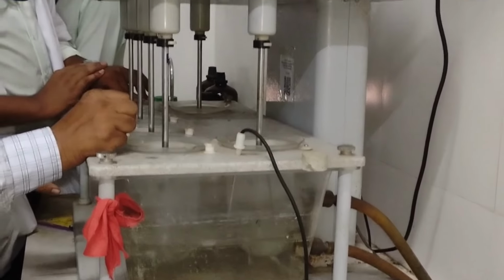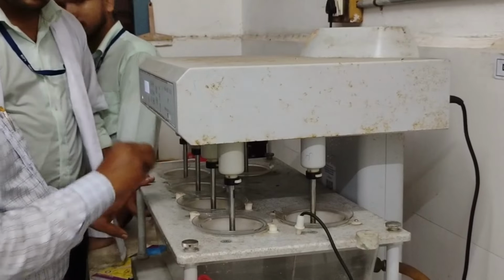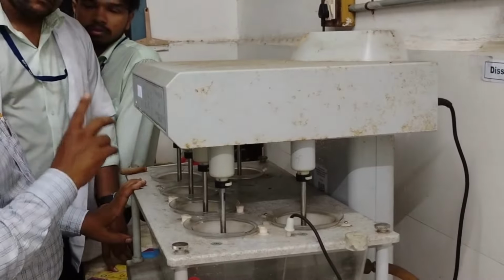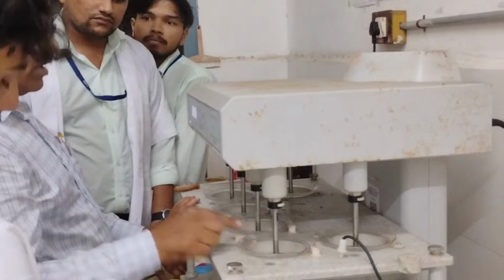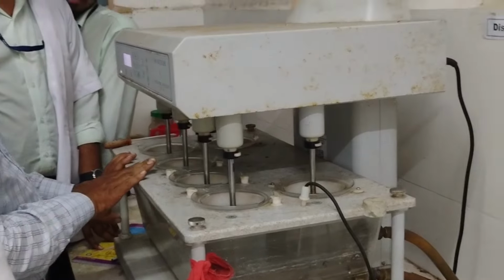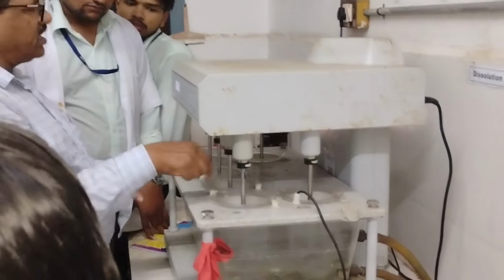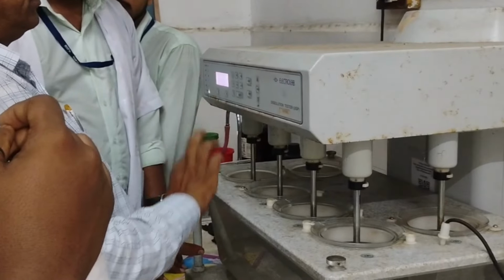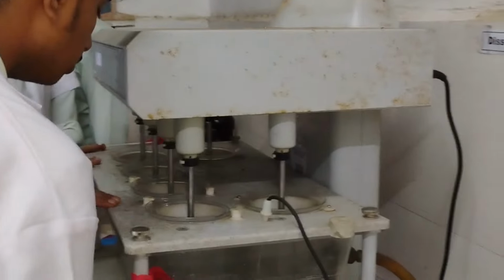At last, the dissolution test. Dissolution is the process in which a substance goes into solution. Dissolution testing measures the extent and rate of solution formation from a dosage form such as a tablet, capsule, ointment, etc. Dissolution of a drug is important for its bioavailability and therapeutic effectiveness. Dissolution and drug release are the same terms. To properly evaluate the dissolution of drug products, it is critical for the procedure to be standardized. This standardization helps to show consistent quality in production and may serve as a predictive measure of efficacy.